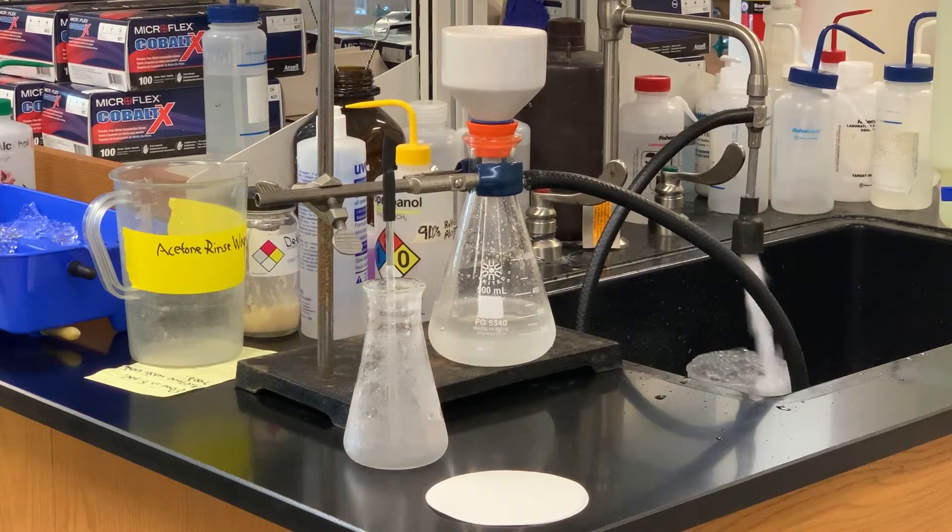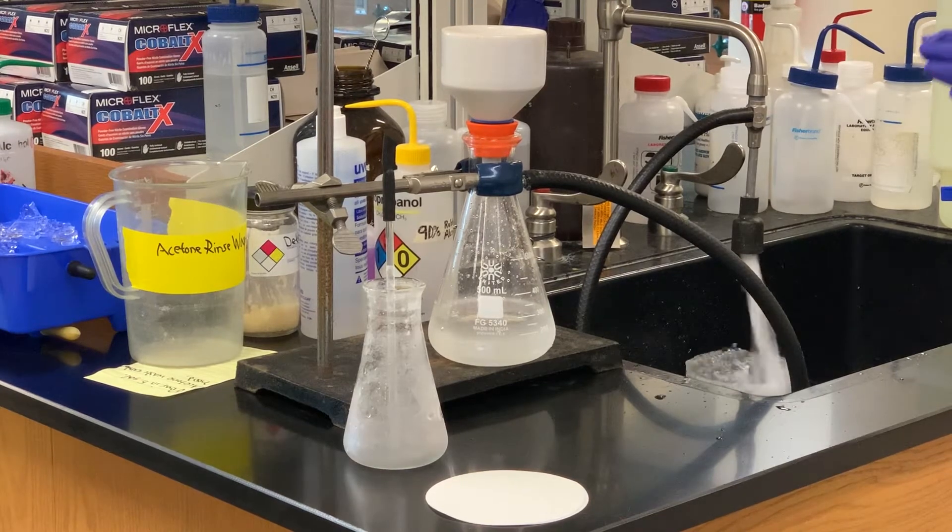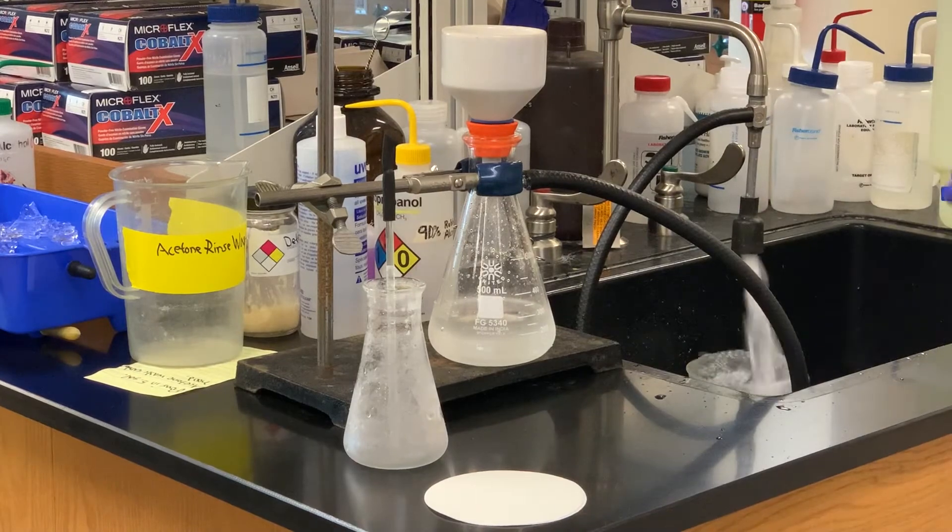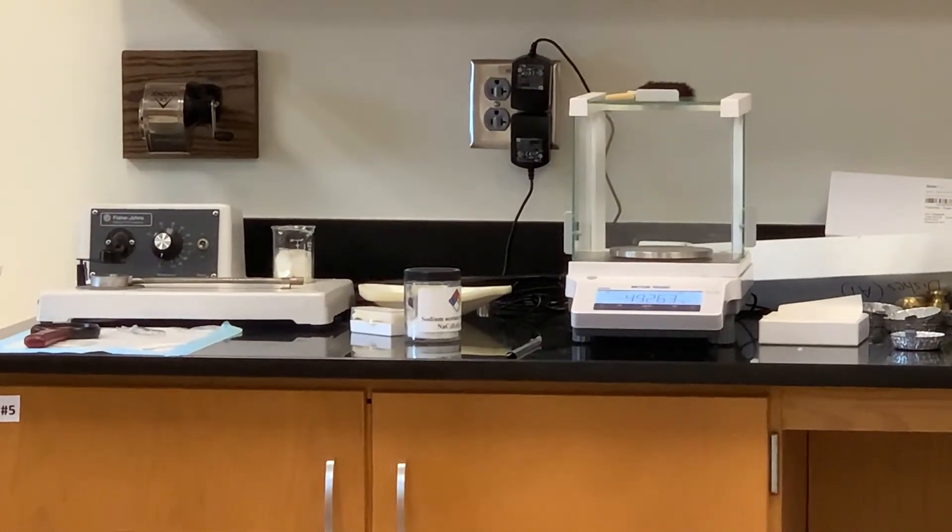I'm just going to let that dry for a few minutes and then what we'll do is we'll take the contents, put them on some larger pieces of filter paper, squeeze it, get out the excess moisture, and get a weight and a melting point.